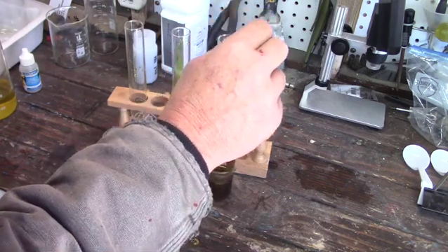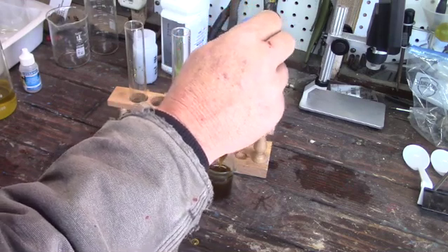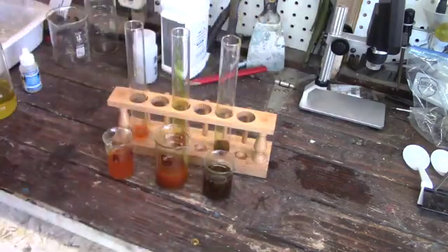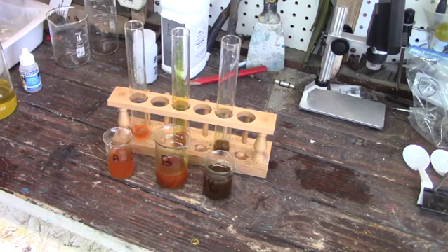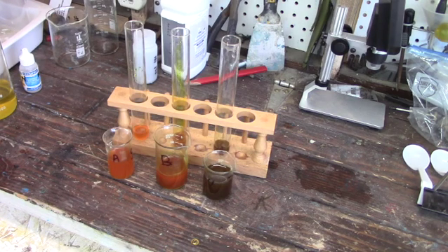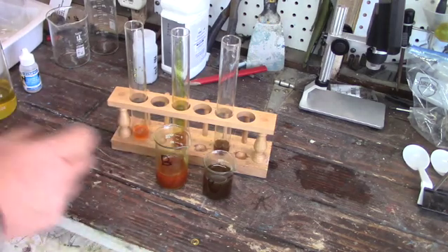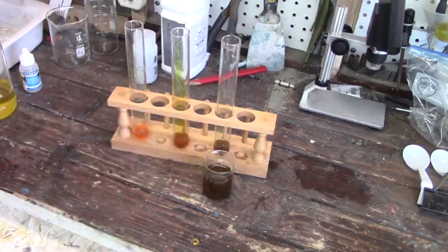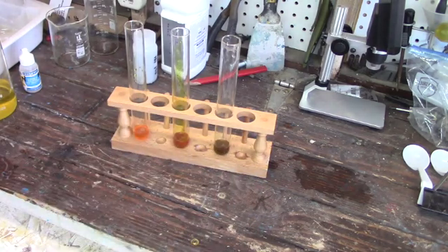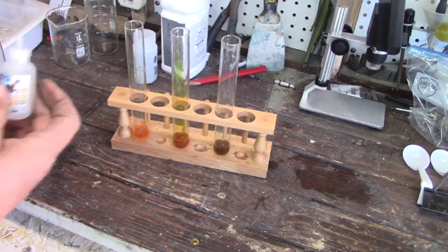From left to right we have all three samples A, B, and C in order. You'll notice how sample C, the one that I thought had iron in the rock, is much darker. I don't know if I can test for iron, or if I'm just going to have to push on and see what we get. But the stannous chloride should tell us what we have. If there's no gold, the stannous won't react — it reacts with gold, platinum, and palladium, so it won't react with iron.